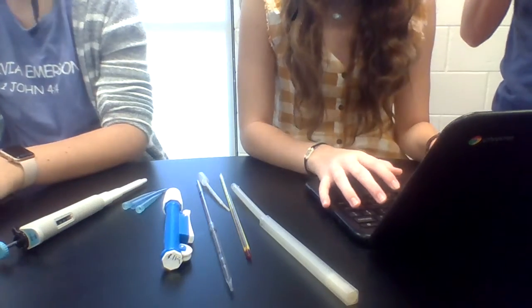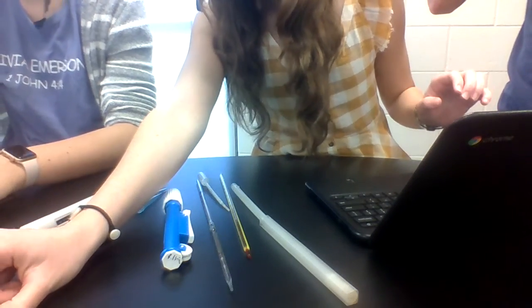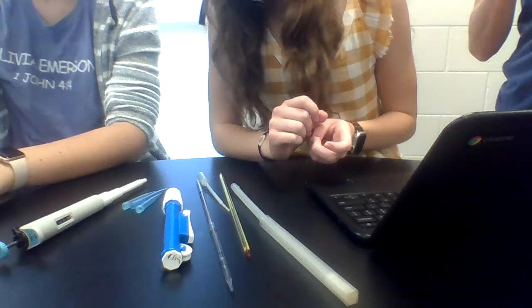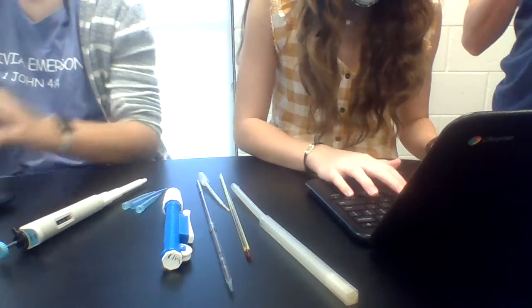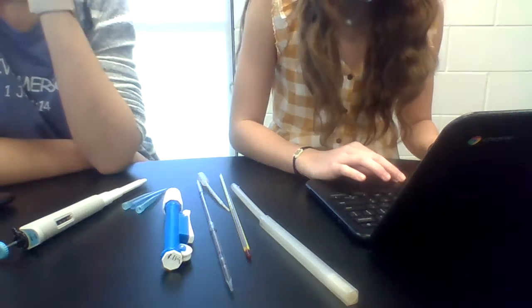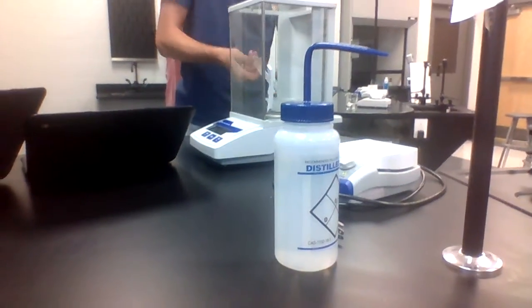One point 46. Is that what it says? Yeah, it just keeps changing. 1.44. Let's just do that. Okay, this scale keeps messing with me. Okay, now we're doing it in this one again. Is it on there?